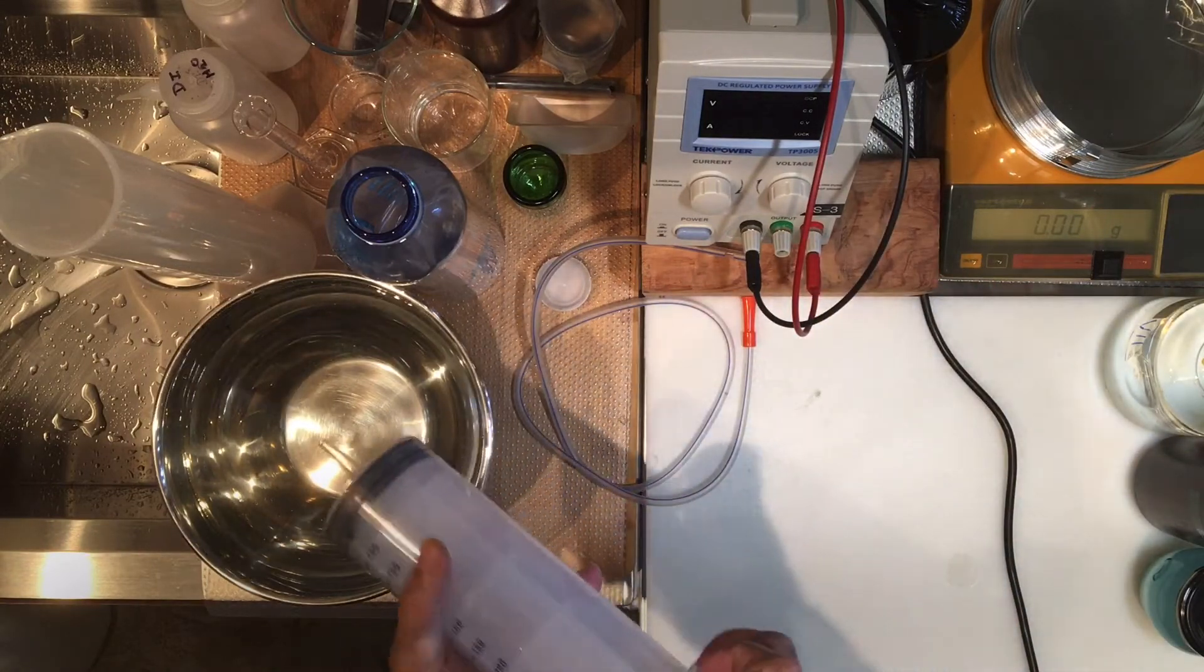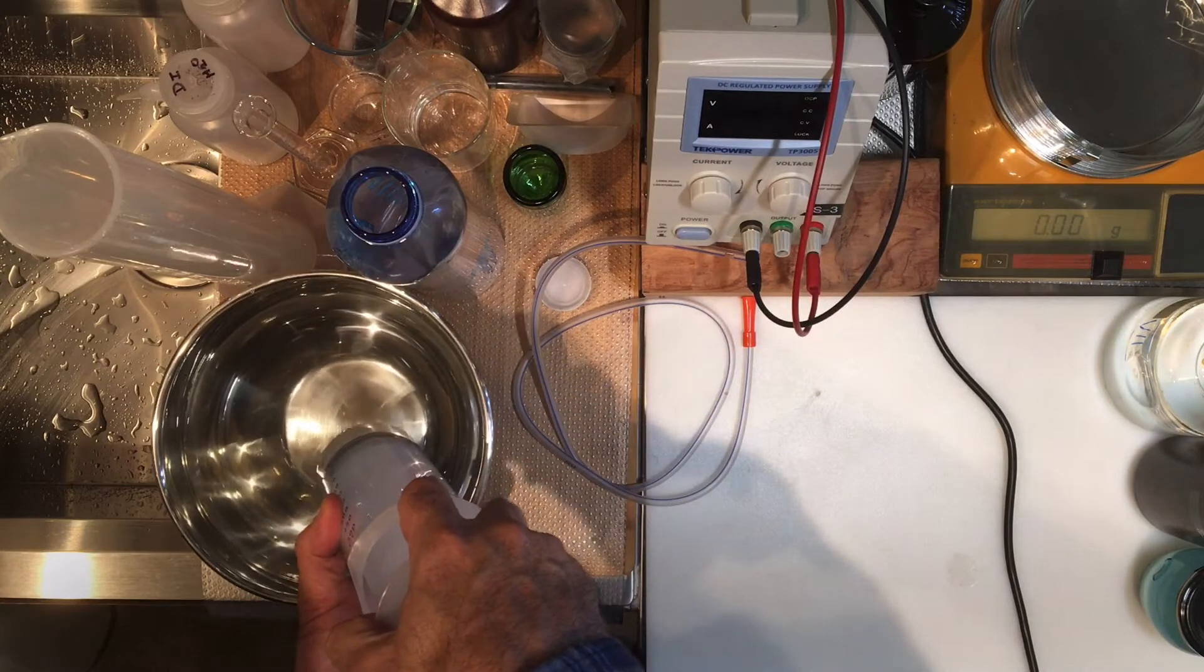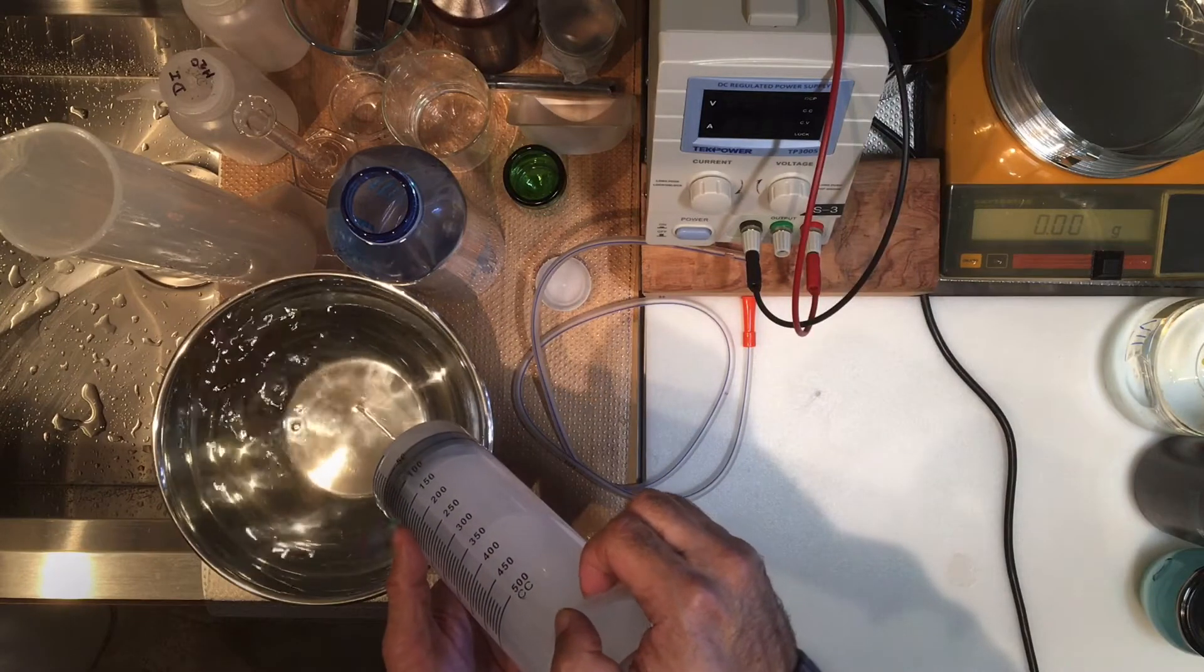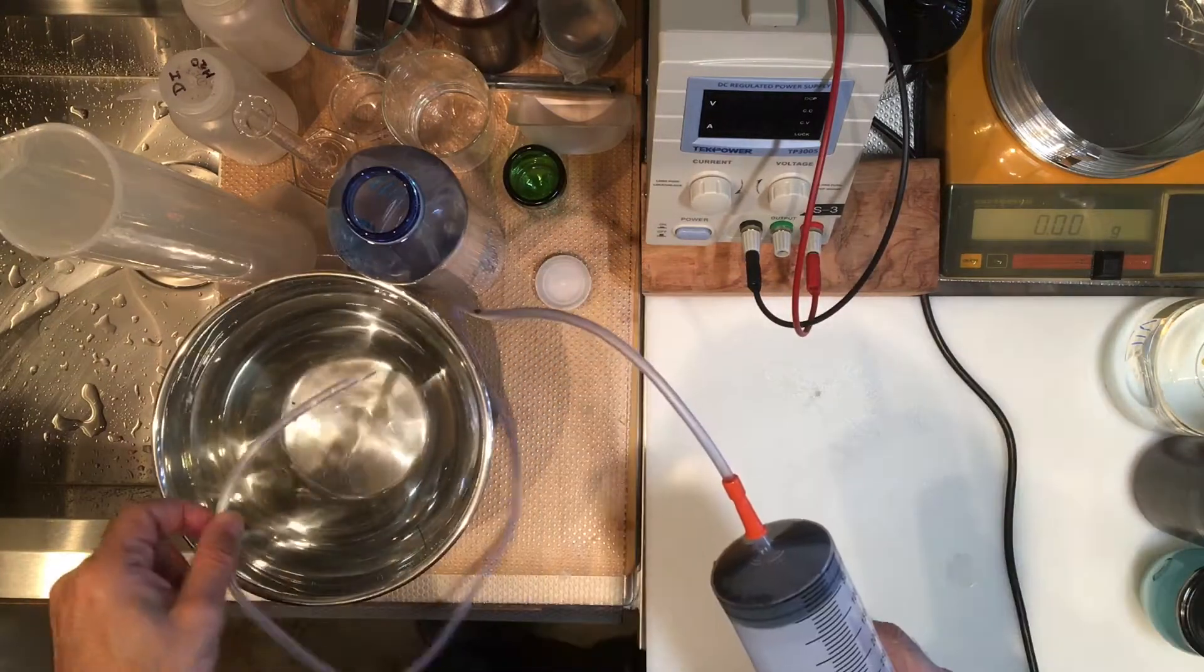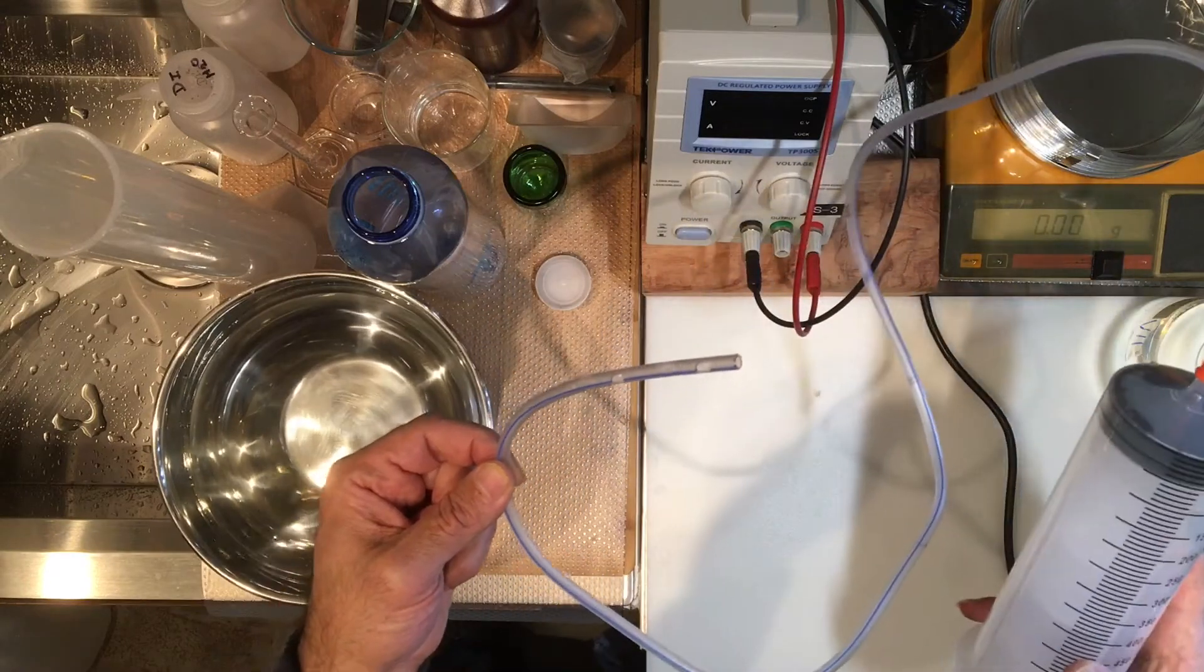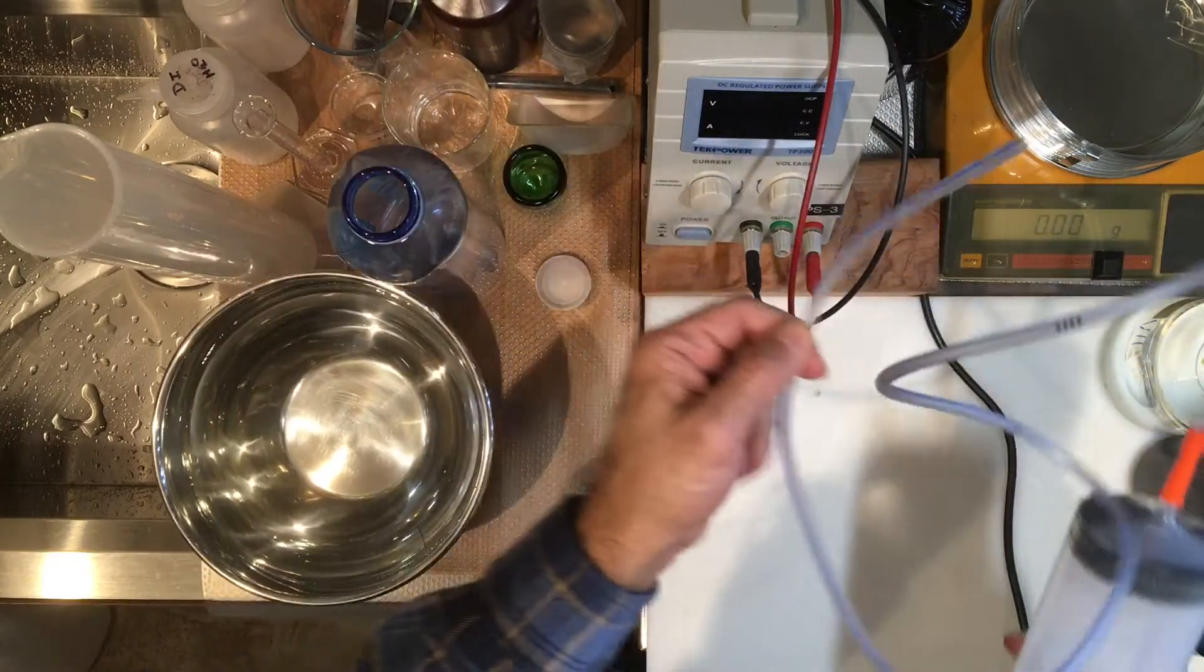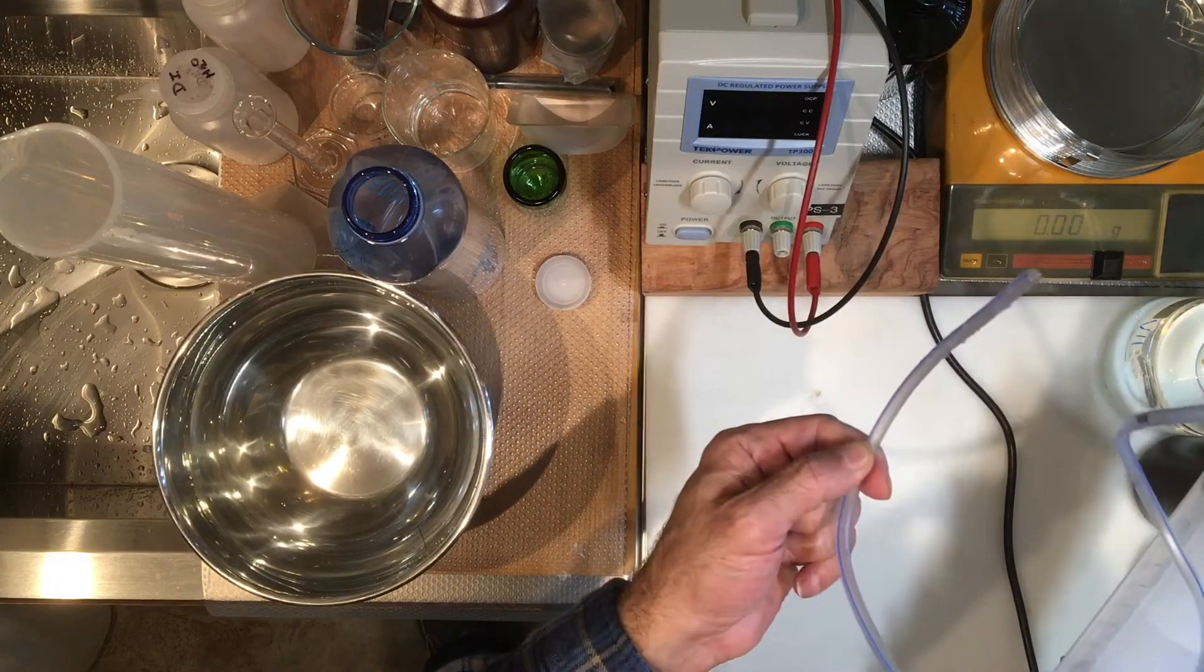Let's go ahead and fill it to the 500 milliliter mark. I already have a little problem here because there's air trapped here. I don't want that. In order to prevent that I thought about having this tubing. The tubing actually came with the syringe, so this might make it a little easier. When I bought this syringe I was surprised the tubing came with it. The procedure in the tubing was giving instruction on how to empty stomach contents. Apparently this tubing has like several holes here, so it's somehow to be inserted in someone's esophagus, and once it makes it to the stomach you can empty out the content of the stomach.